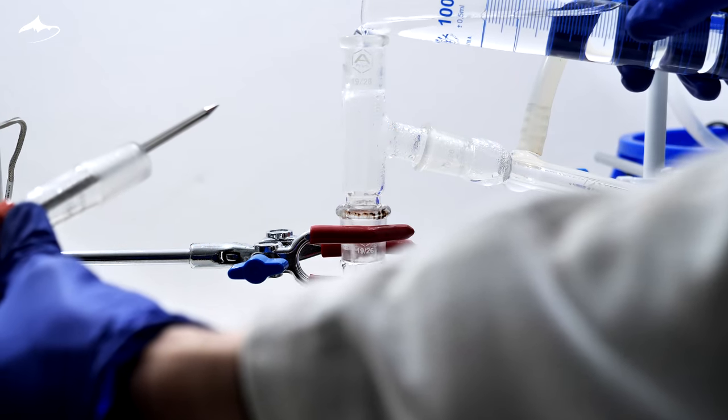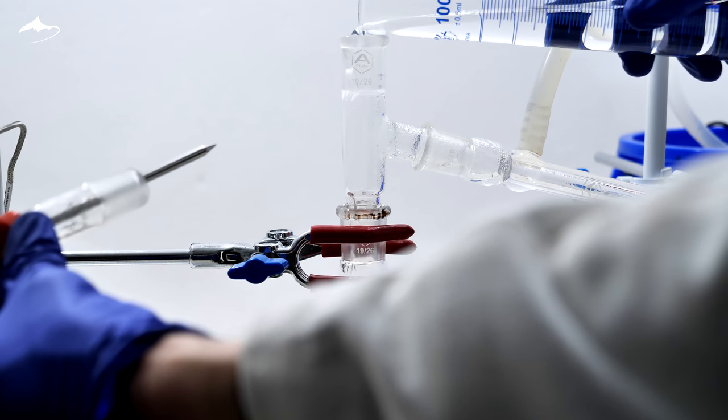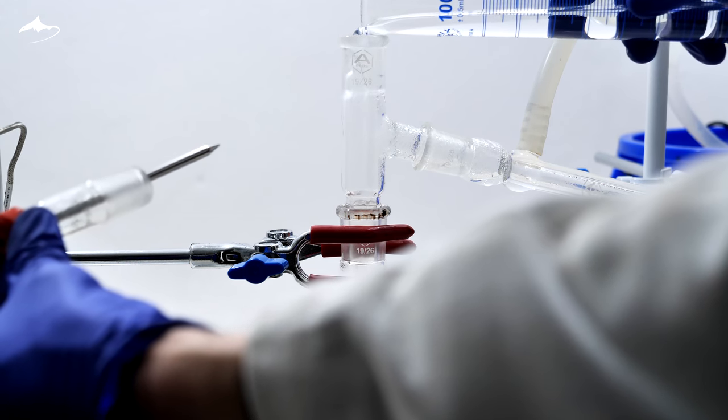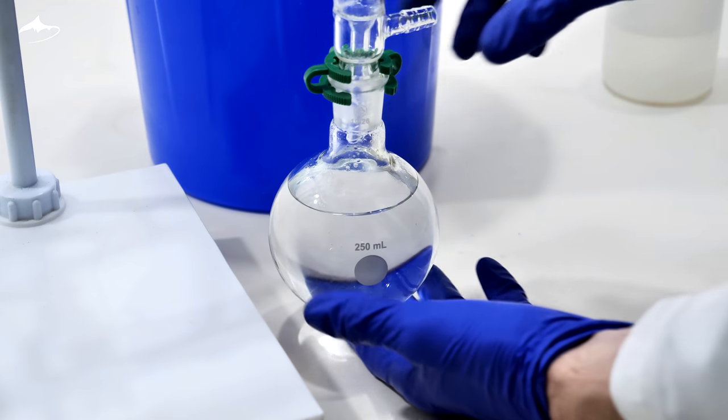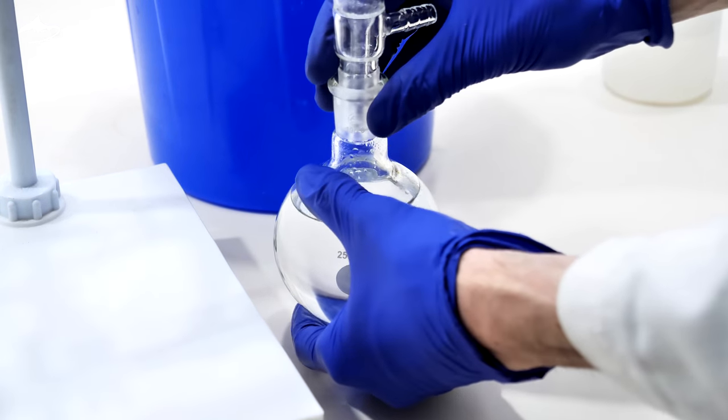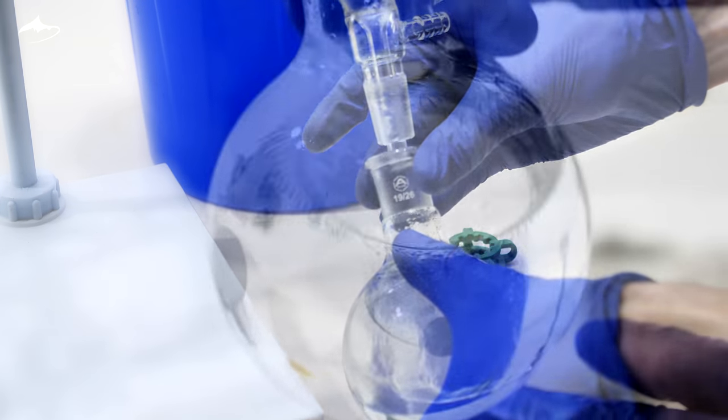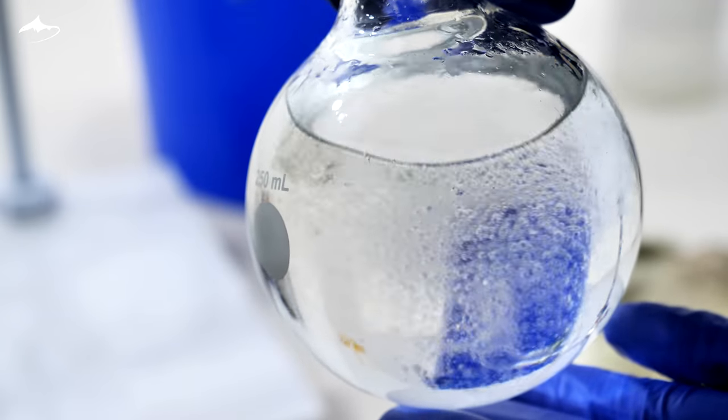I had to add more water as the volume is too small in the flask. Eventually, I stopped the distillation as I got enough distillate to fill up the collecting flask. Here you can clearly see the presence of an organic phase.